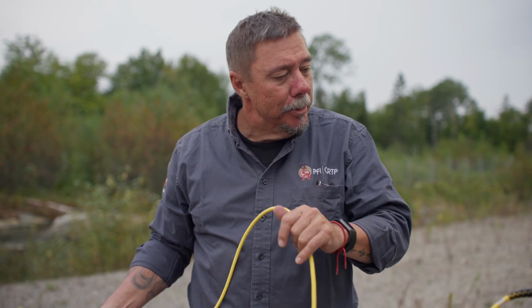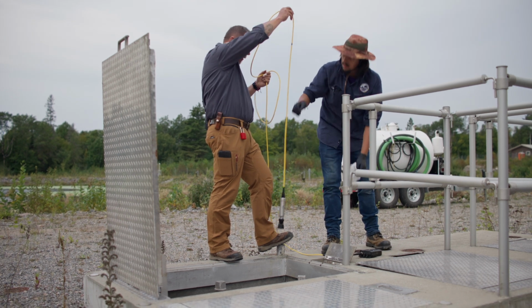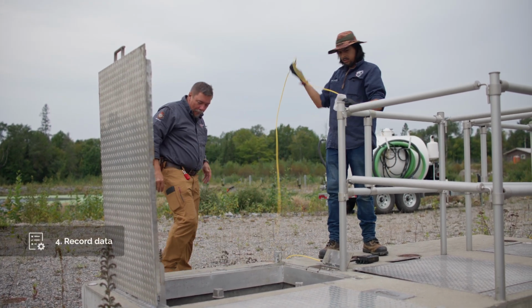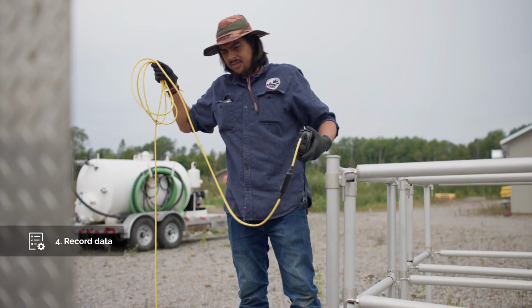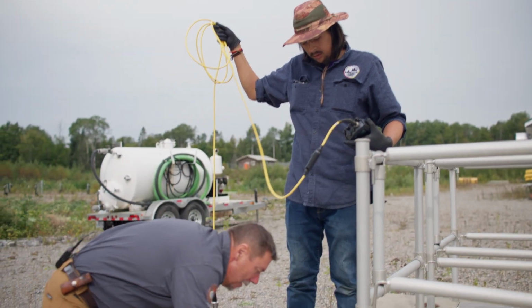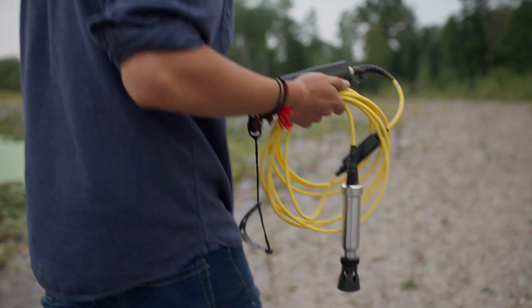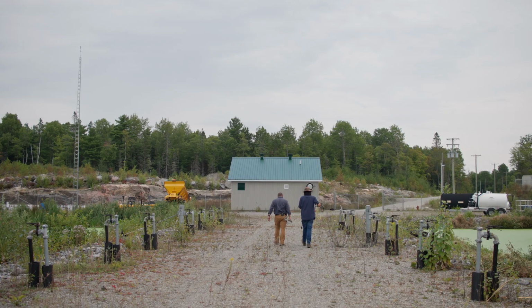Okay, so this is done for here. Now we'll go to the effluent and see what reading we got there. Here we have 7.43, so we have plenty of oxygen on this side. That's why it's important not to take readings only at the effluent, because the readings will always be higher here than at the beginning of the treatment. So always try to take it at the exit of all lagoons. So we're going to go increase the capacity of the blowers.